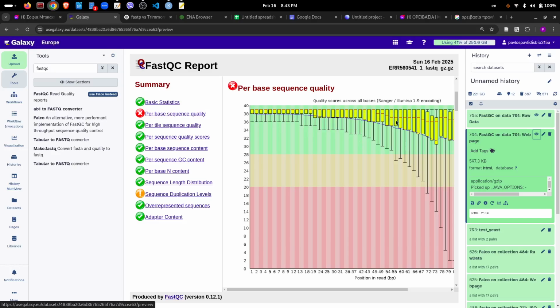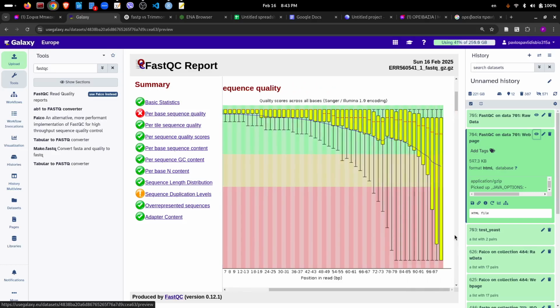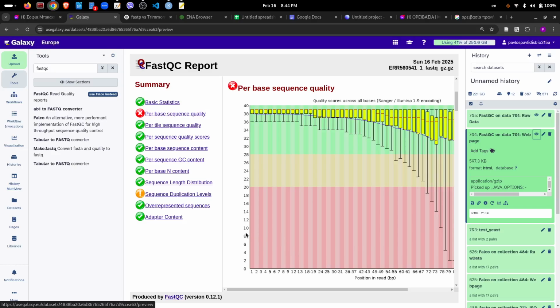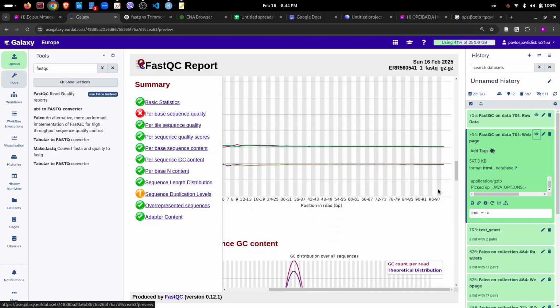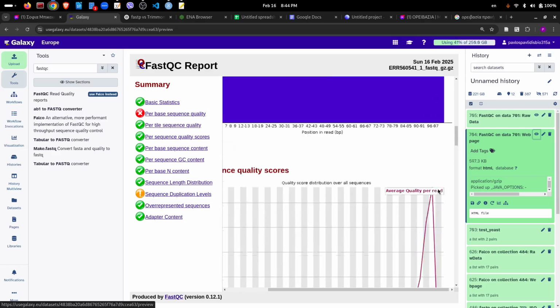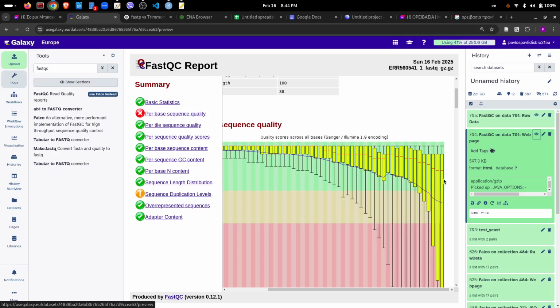For example, you see here the distribution of qualities, and you see that towards the end, look here, there are several cases where the quality of the reads drops very, very low. Look at the qualities here. It's something like 6, 8, and so on. You remember the previous plot, our lowest quality was something like 26, 27. This happened because we had done some trimming and we had removed parts of the reads that were towards the right, the 3' end of the read. And the other plots are similar actually. This plot indicates that we should do some trimming towards the right end. This is exactly what Fastp does actually.